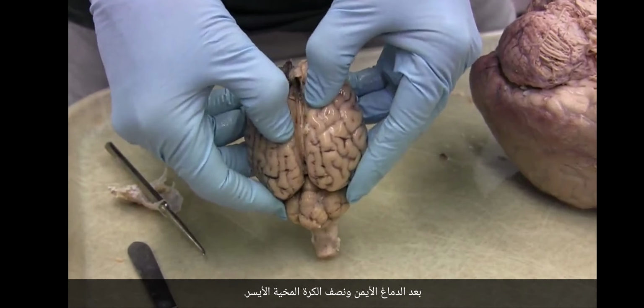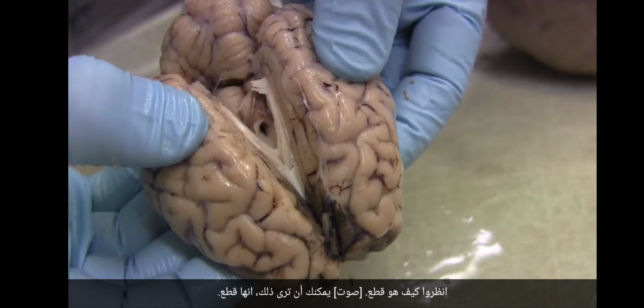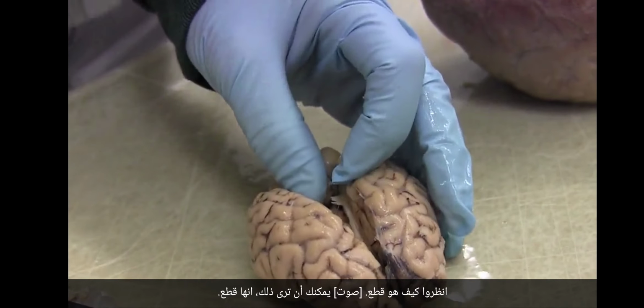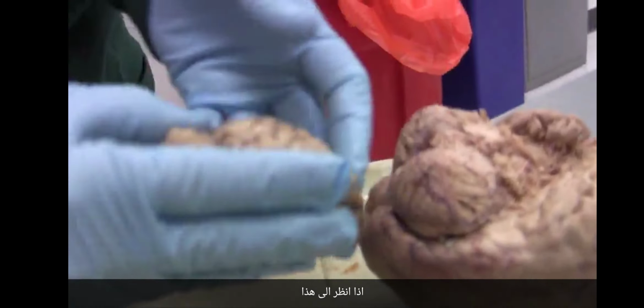So I'm going to cut that. Look at how it's cutting. You can see that it's cutting. Okay, so then look at this.